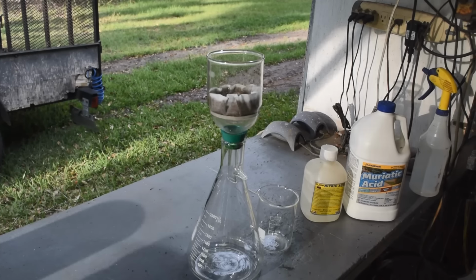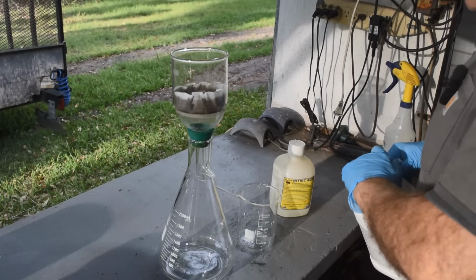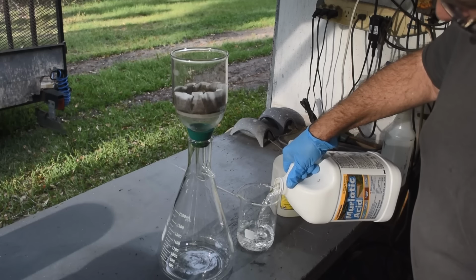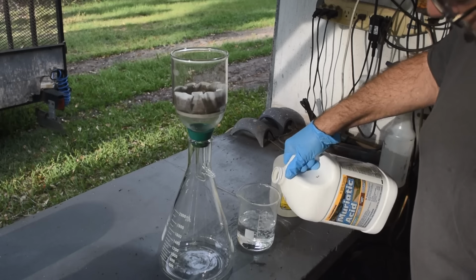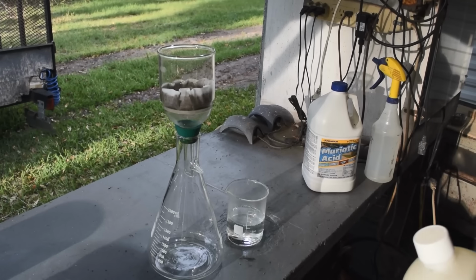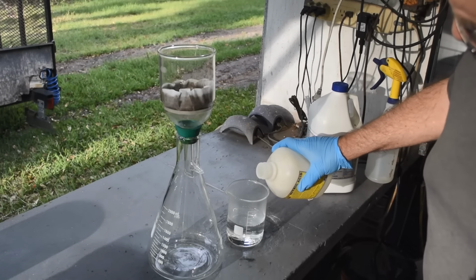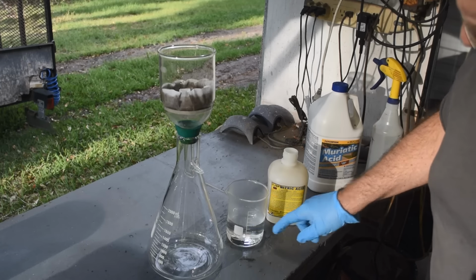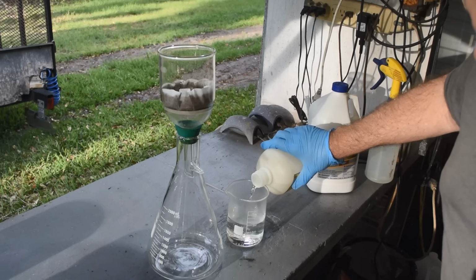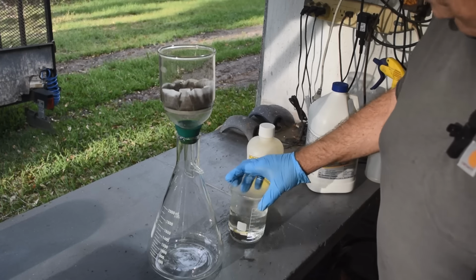All right, since we should have pretty much nothing left but gold in here, it's time to dissolve it with some Aqua Regia. So I'm going to make up some fairly strong Aqua Regia. I'm going to do about 300 milliliters hydrochloric acid. Whoops, sorry. My big size 13 foot kicked the tripod leg. Sorry about that. And I'm going to put in, let's see, that's 50 milliliters is the next one. So we're going to go with maybe about, eyeball about 30 milliliters nitric acid. That's going to be some strong Aqua Regia.